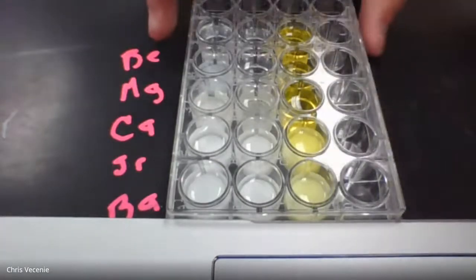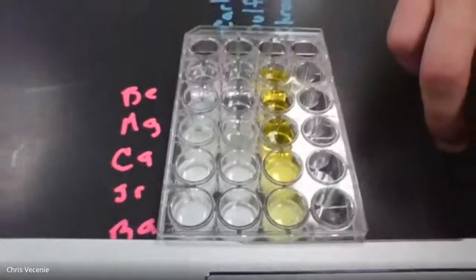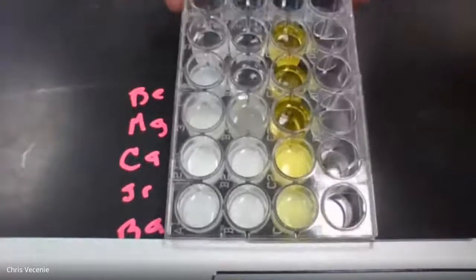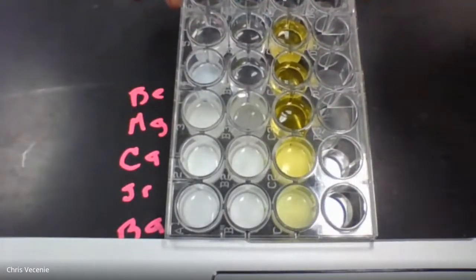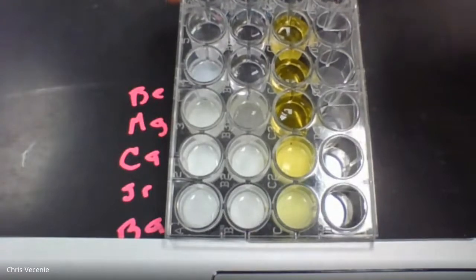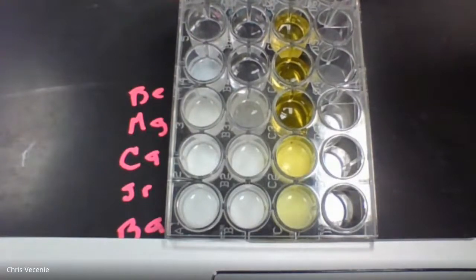If I tip this up for you, give me a second, try to get you a good look. Tip this up. You can see each of these reactions as you go through. This would be a good time to pause the video. I'm not going to hold it here forever. Then you can make your observations for each experiment.